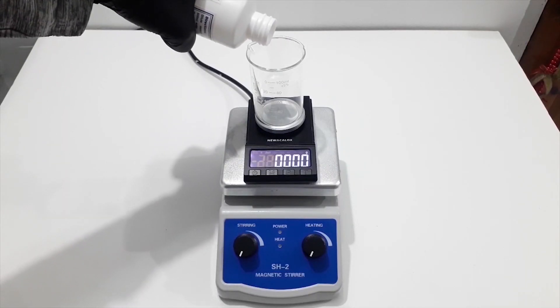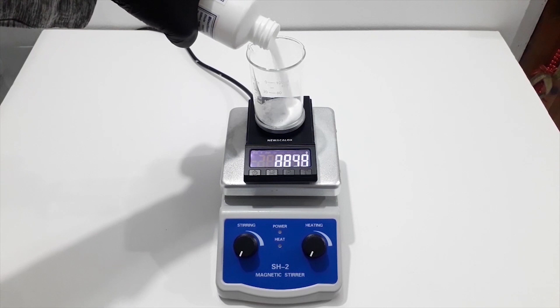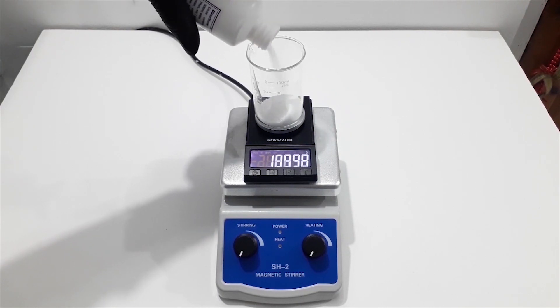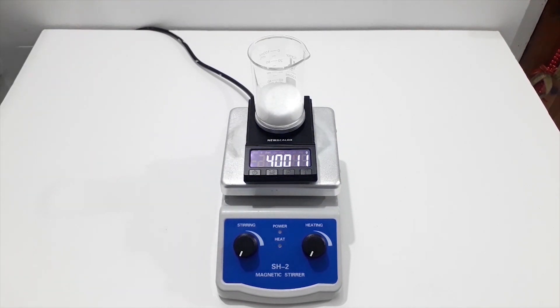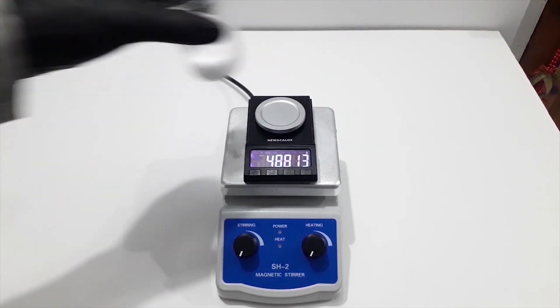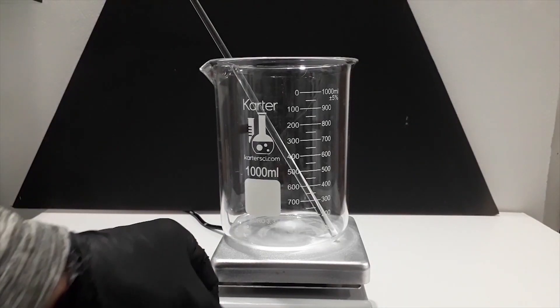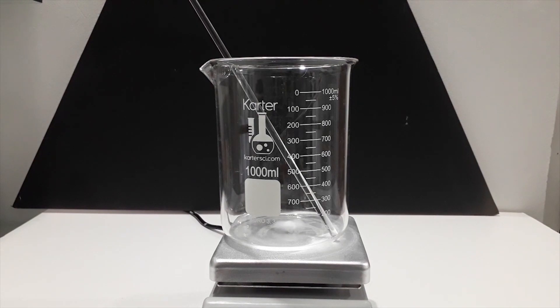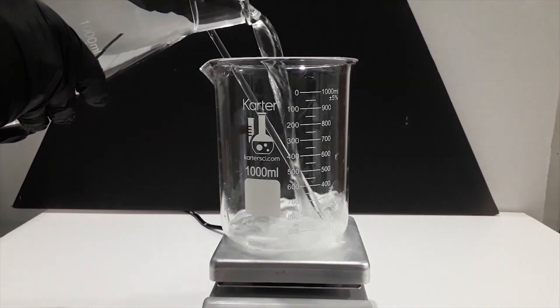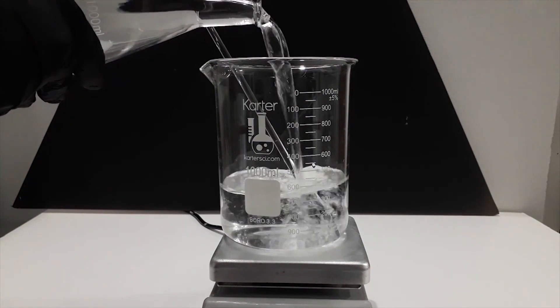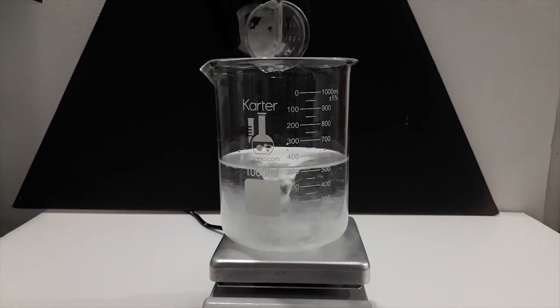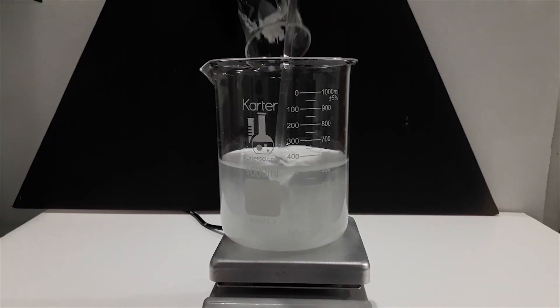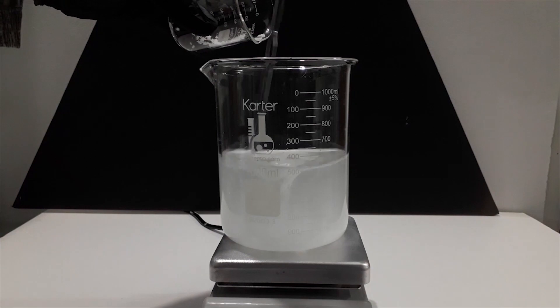All you have to do is just to make sure that the ingredients are in the material safety data sheet. The solution used in this video is 40 grams sodium hydroxide dissolved in one liter, which makes a one molar solution. However, ideally, a four molar solution must be used. I turned on the stirring and added about 500 milliliters of water to the beaker along with sodium hydroxide.